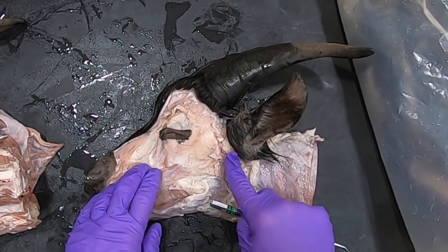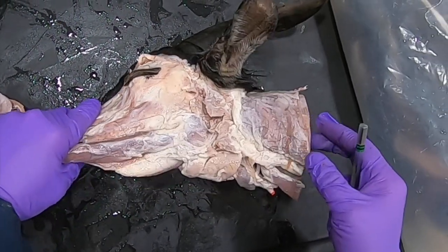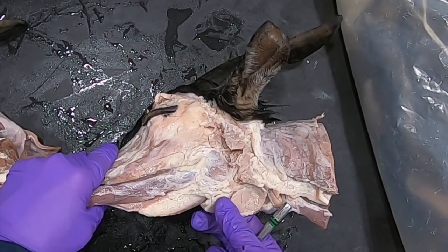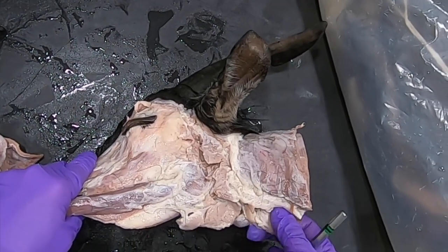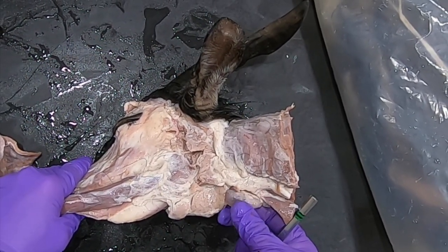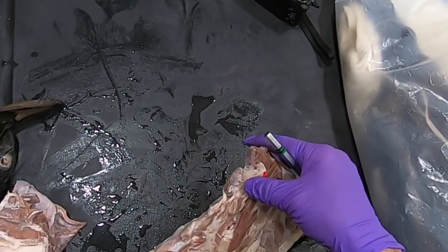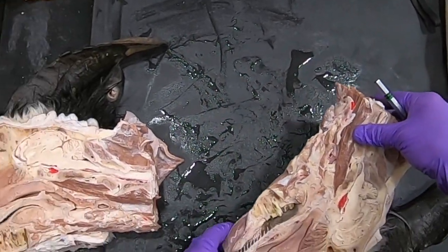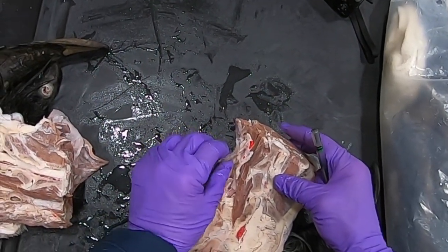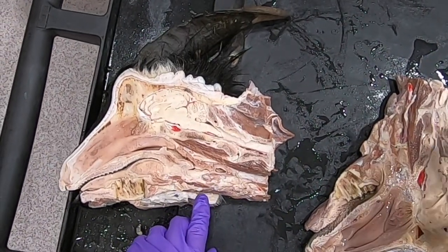Once again, that's our parotid salivary gland. Down here we have our mandibular salivary gland and our mandibular lymph nodes. There's our thyroid gland — remember the thyroid gland is always at the junction of the larynx and the trachea.